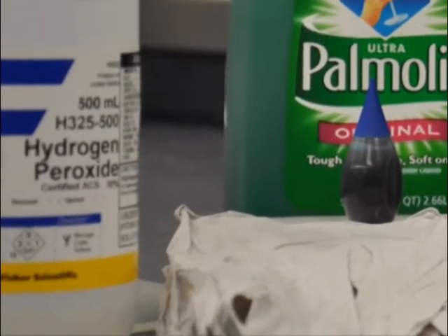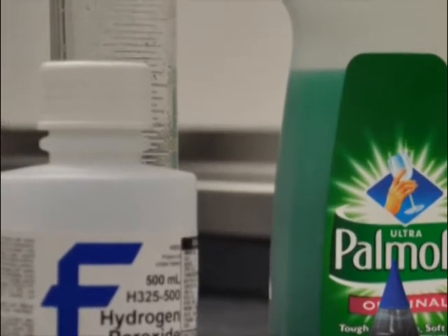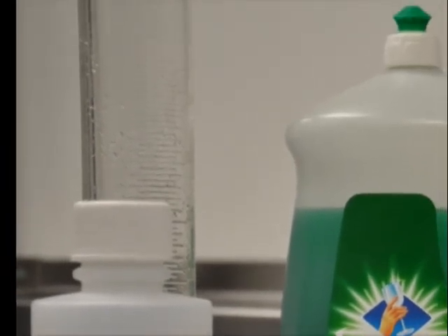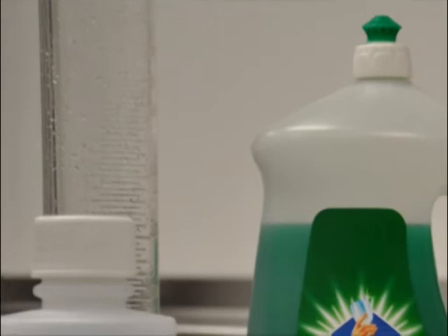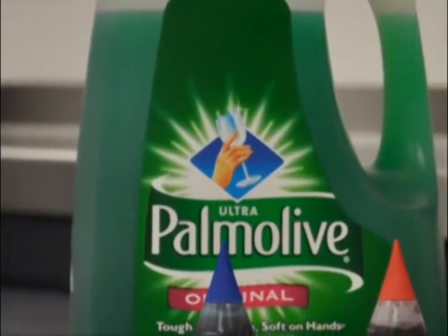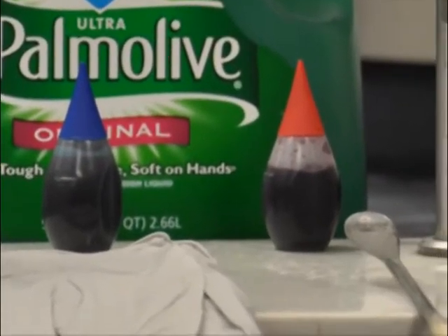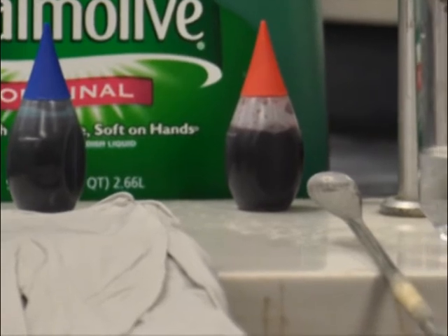To run a reaction, we suggest using a graduated cylinder, either 500 or 1000 milliliters. Optionally, simple food coloring will make this experiment more visually appealing. You will also need a small spatula for your solid potassium iodide.